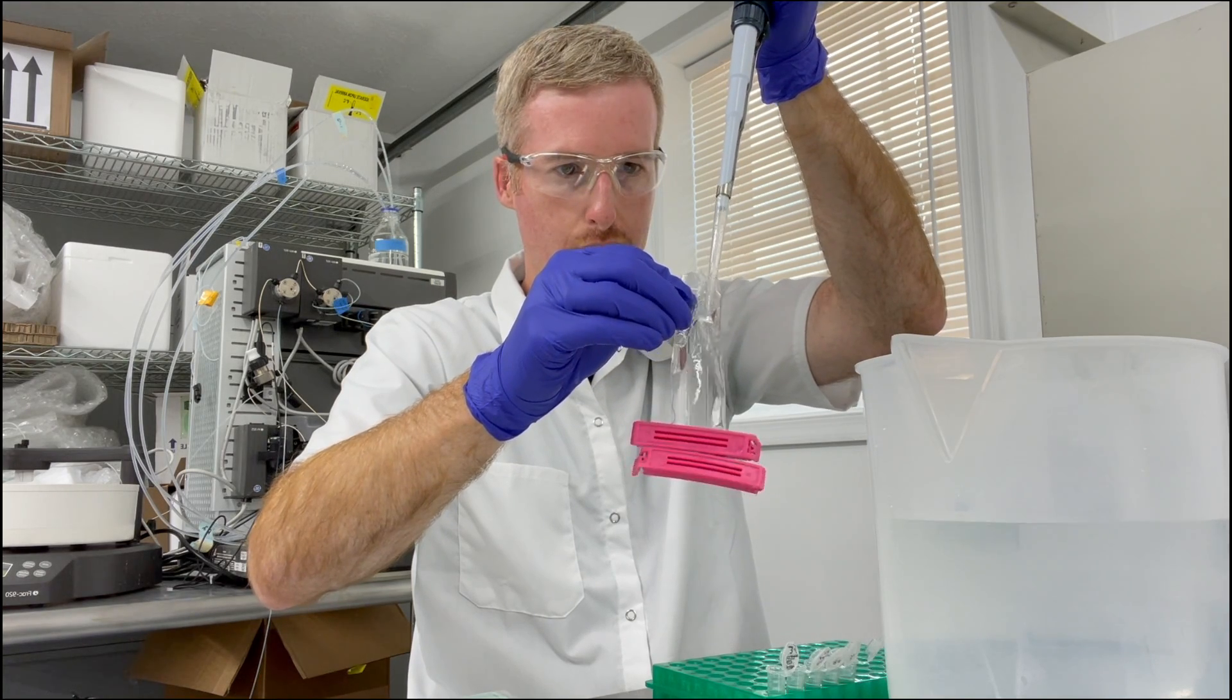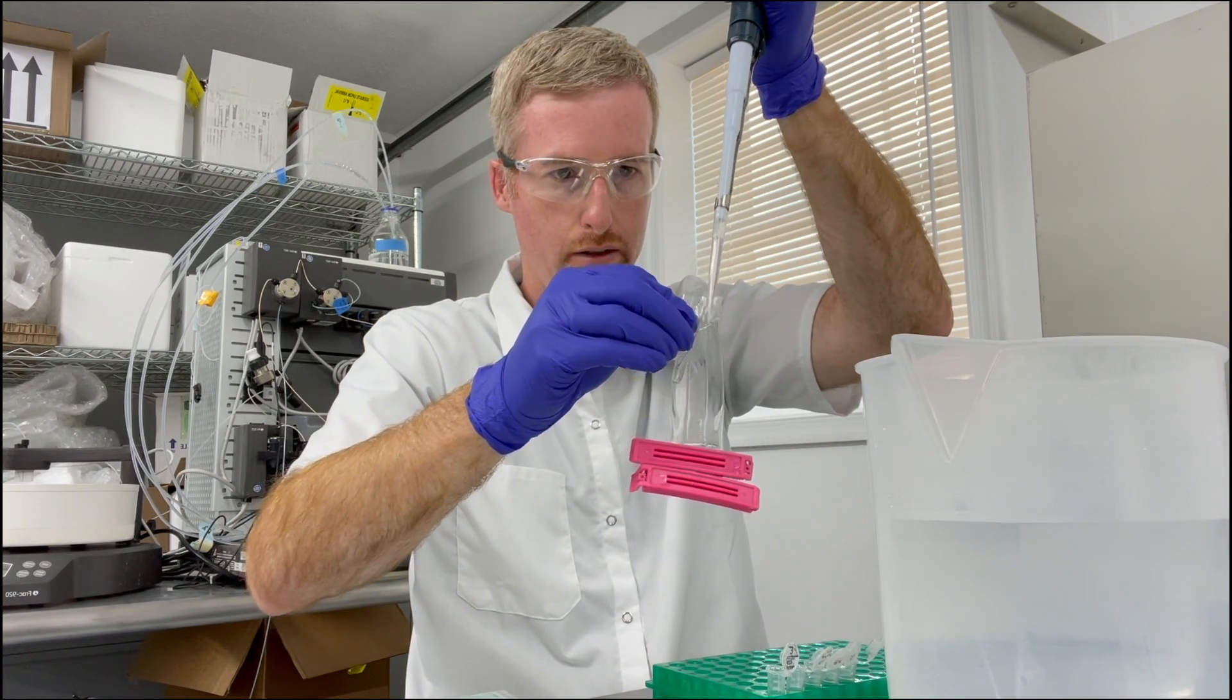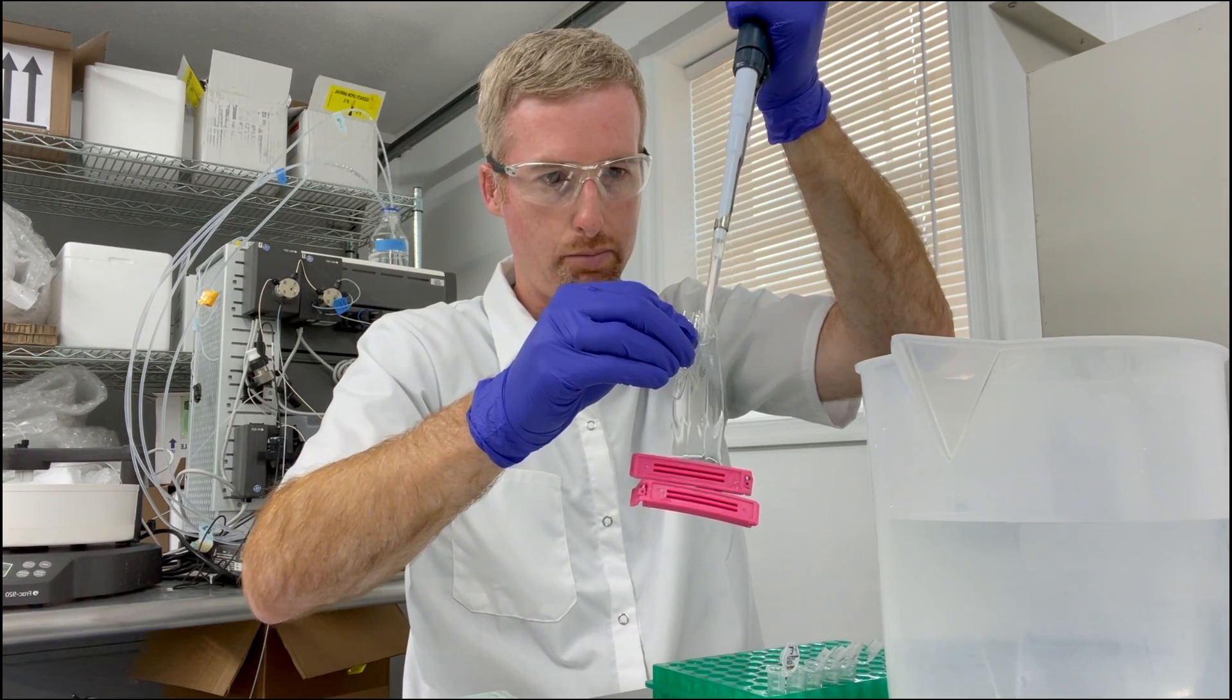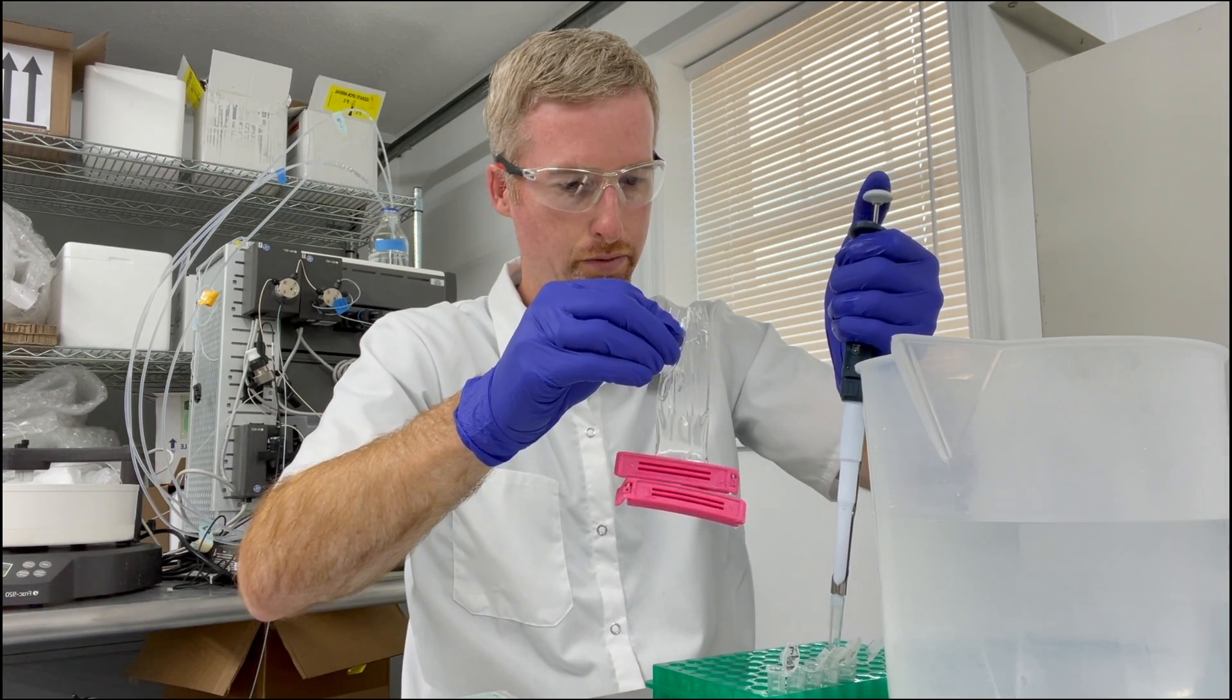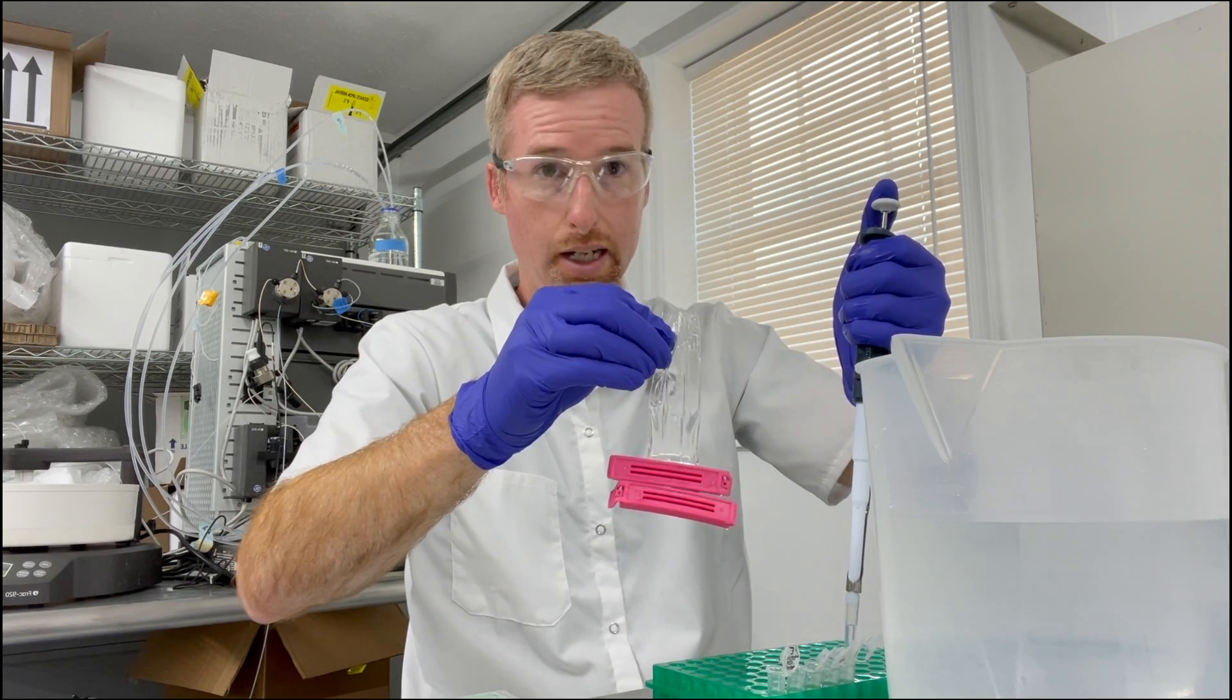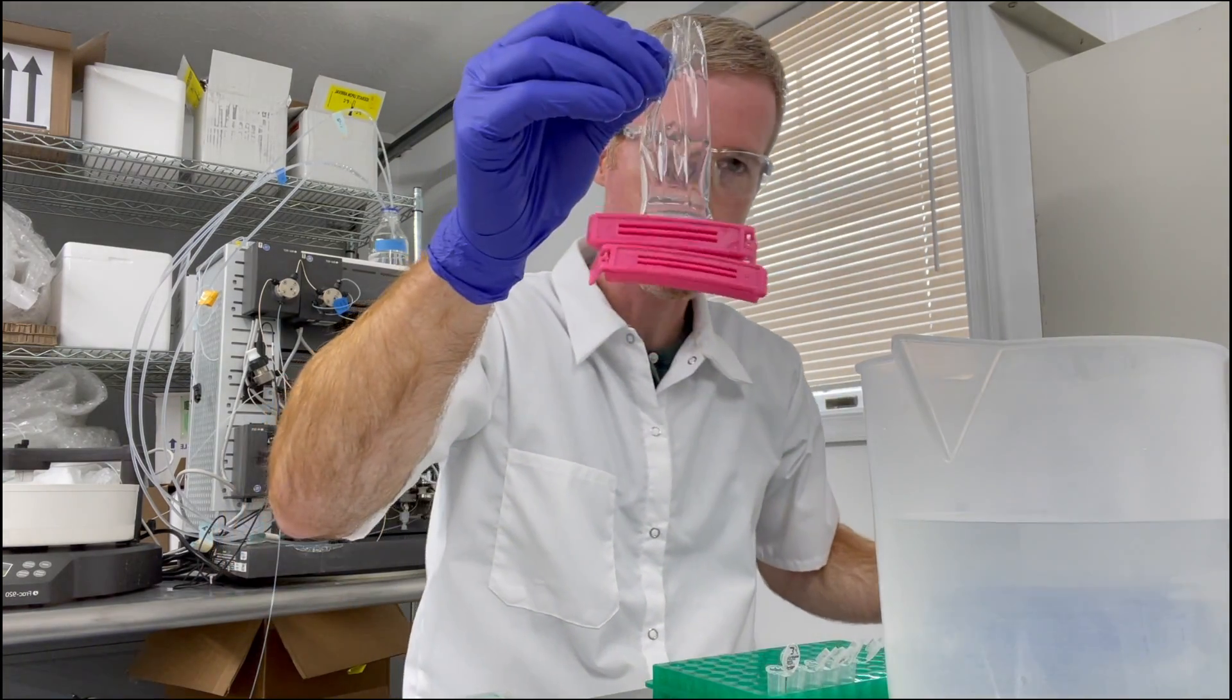Now I'm going to be dialyzing this protein overnight at four degrees. Hopefully it likes the new buffer that it's going into, otherwise it may precipitate and turn cloudy. So we're going to hope that doesn't happen, but if it does it means that the dialysis is working at least because we exchanged buffers. Okay, so the protein is in the bag.